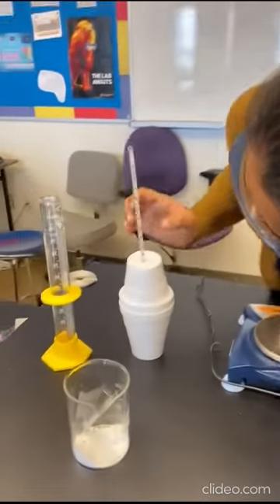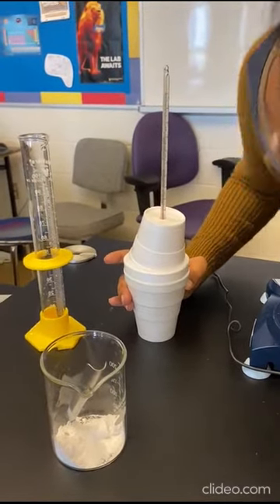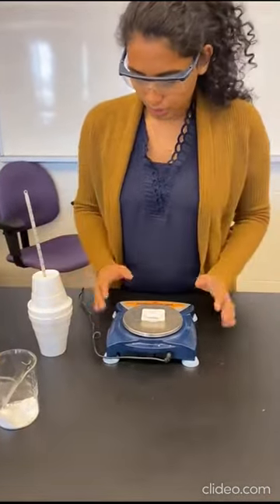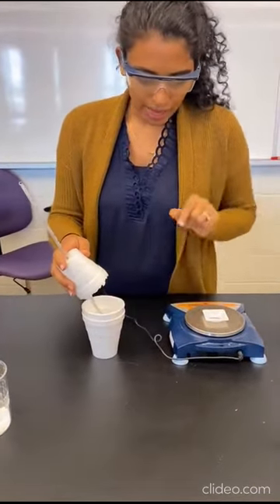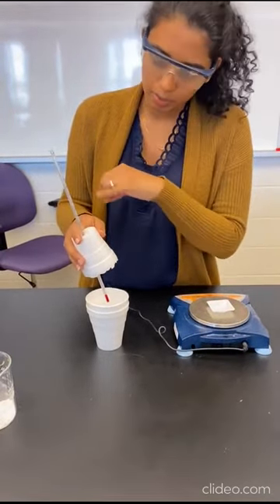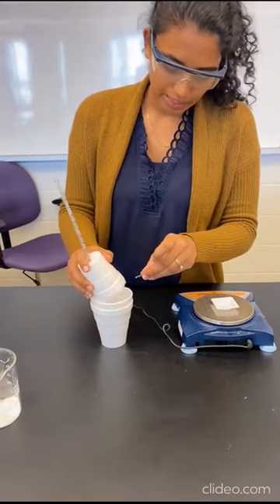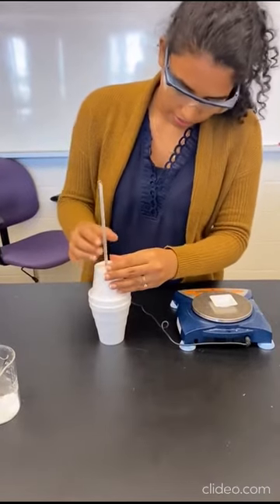And the initial temperature, I would say, is 25 degrees Celsius. Okay, so as soon as I am done measuring both my magnesium and my HCl, what I'm gonna do is now add this magnesium into the HCl. And the only thing that I'm gonna observe from there is this is my T2, or what the temperature becomes. So I'm gonna hold it so that I can immediately close it so I'm not losing anything. So drop it in and stop it there.